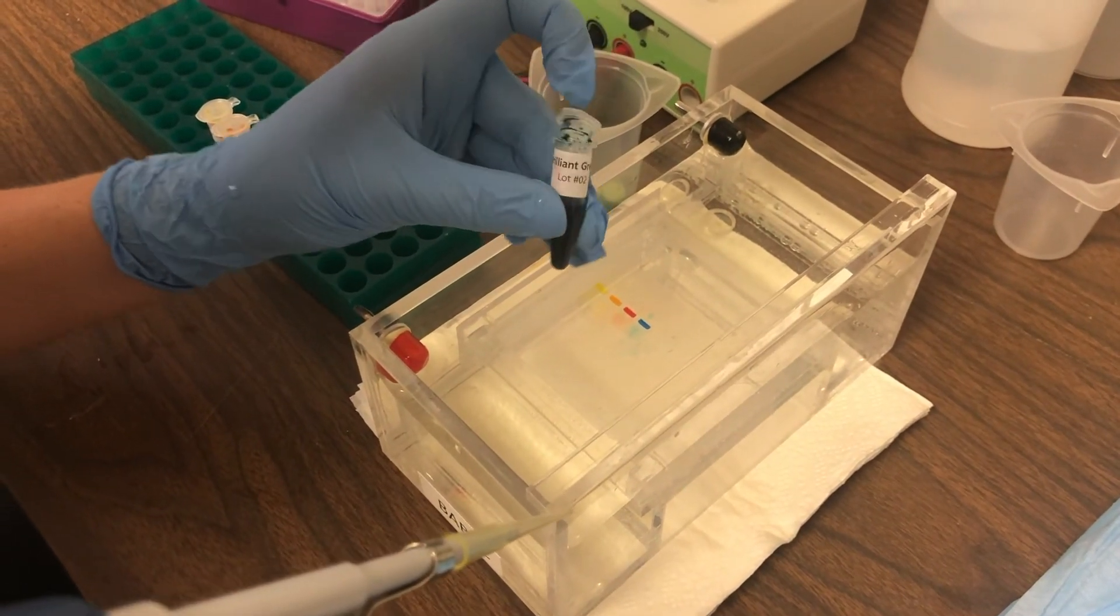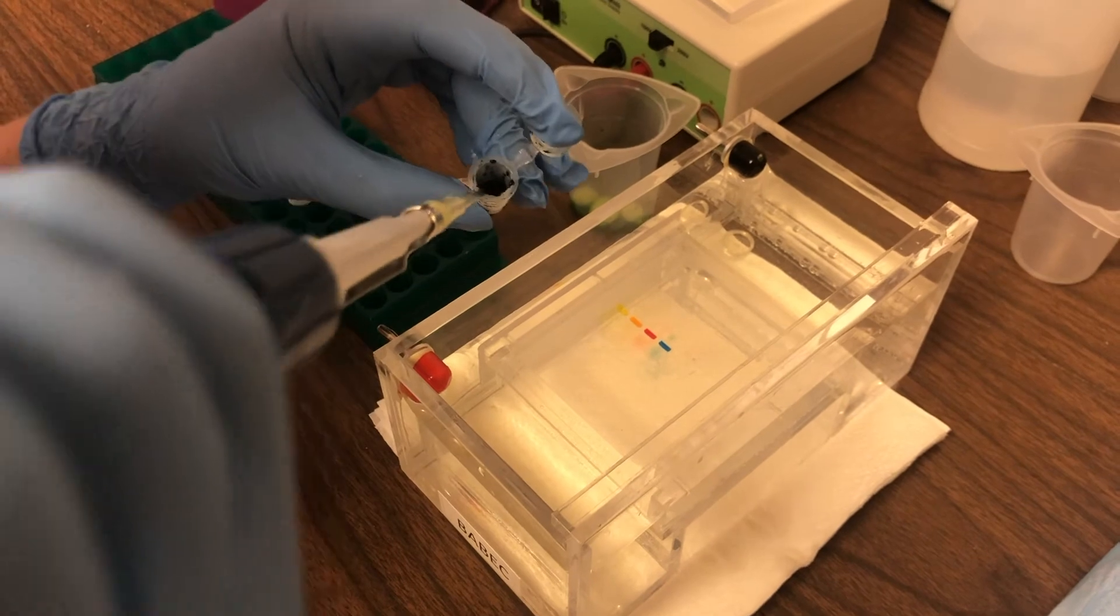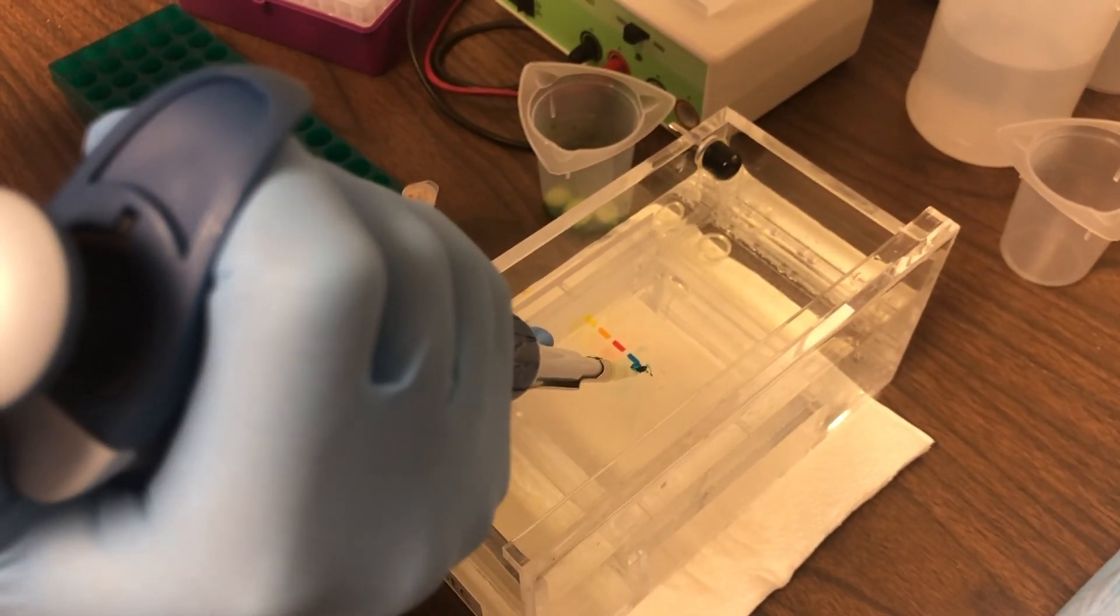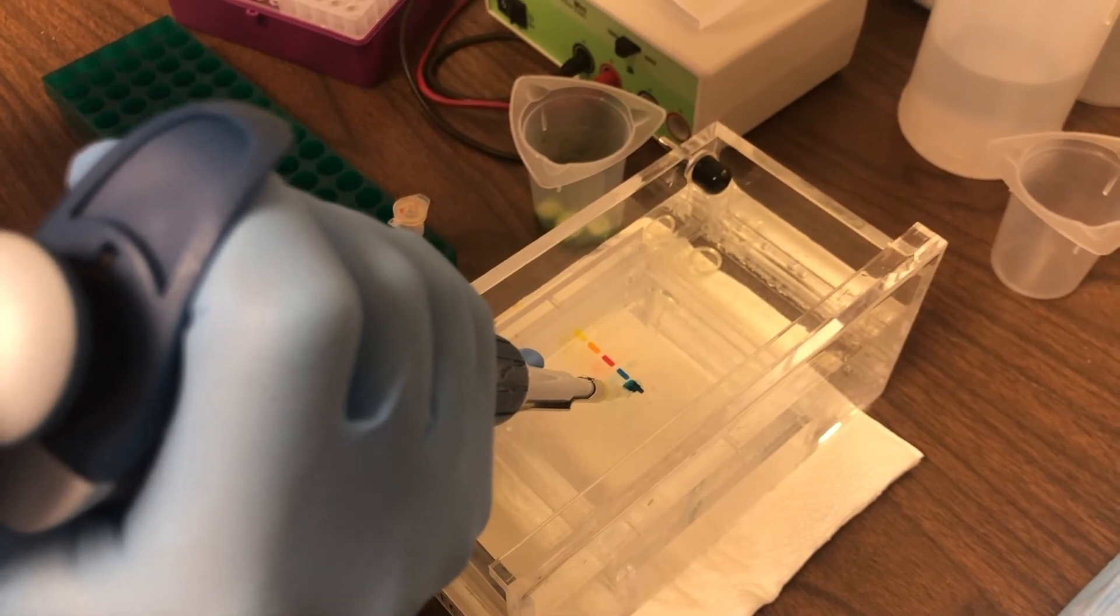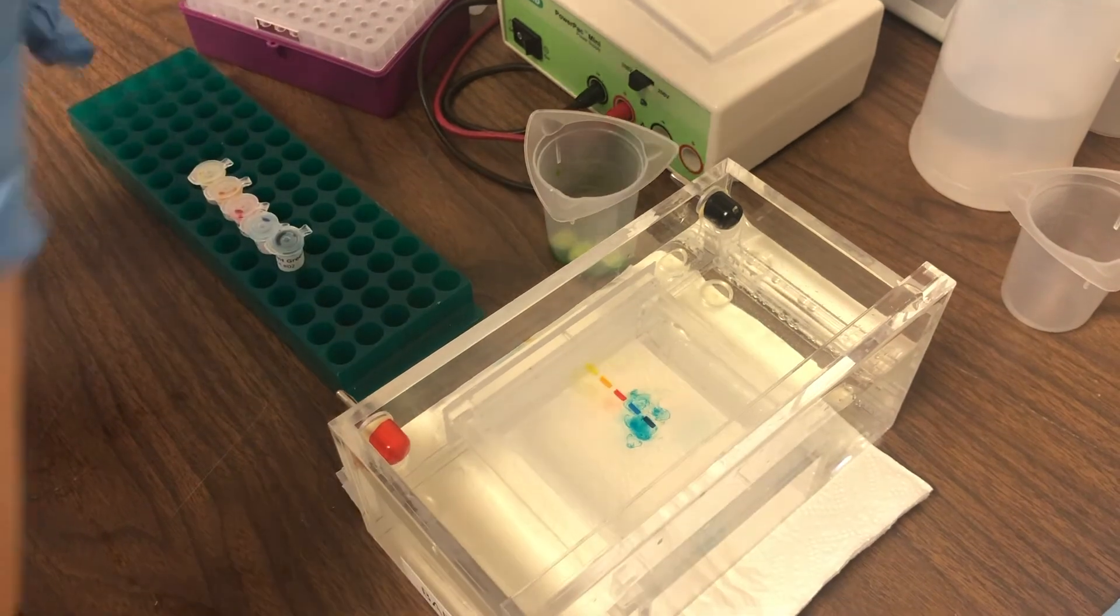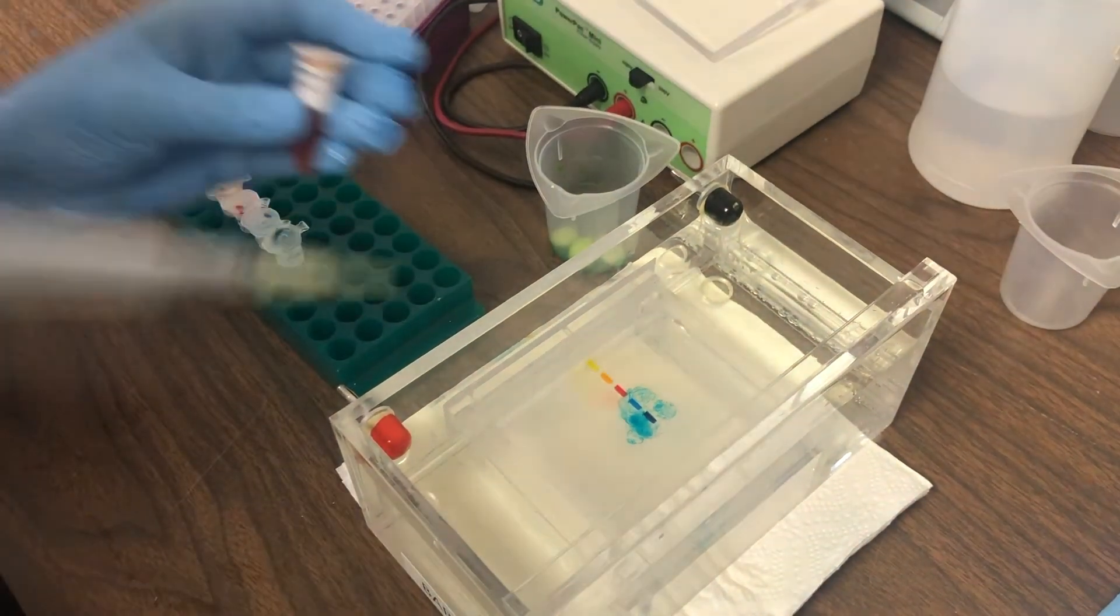You'll see here with this brilliant green, it's really dense. And so when we put this into lane number 5, there's a little bit on the outside. And we think, oh no, did I miss it? No, it just came off into the TAE buffer. You can see most of the sample got into that well.